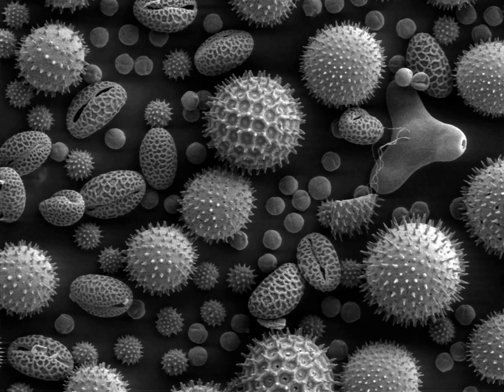A scanning electron microscope is a type of electron microscope that produces images of a sample by scanning the surface with a focused beam of electrons. The electrons interact with atoms in the sample, producing various signals that contain information about the surface topography and composition of the sample. The electron beam is scanned in a raster scan pattern, and the position of the beam is combined with the detected signal to produce an image.